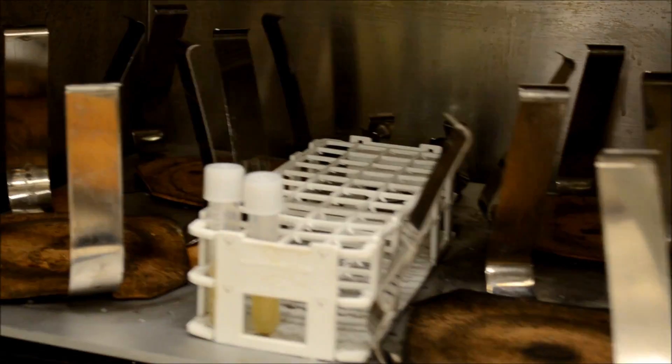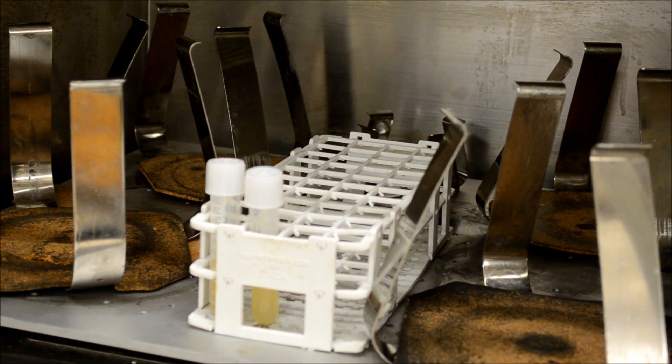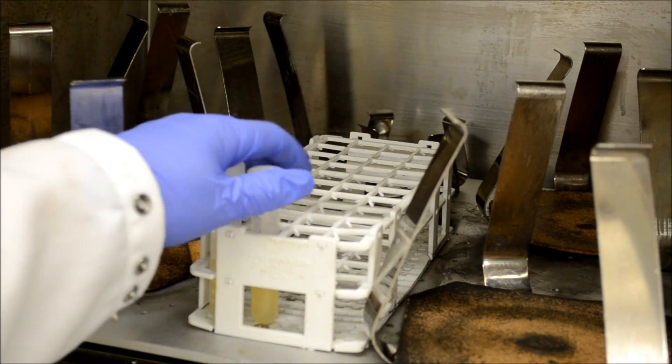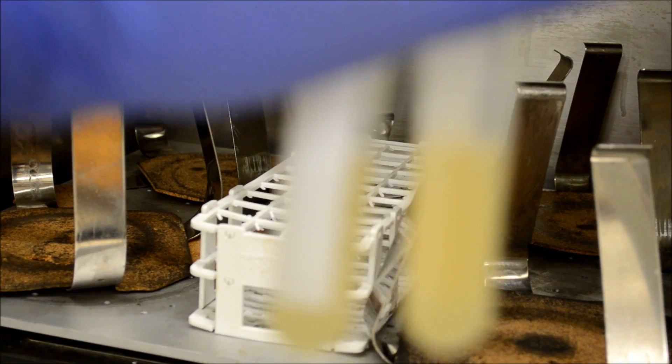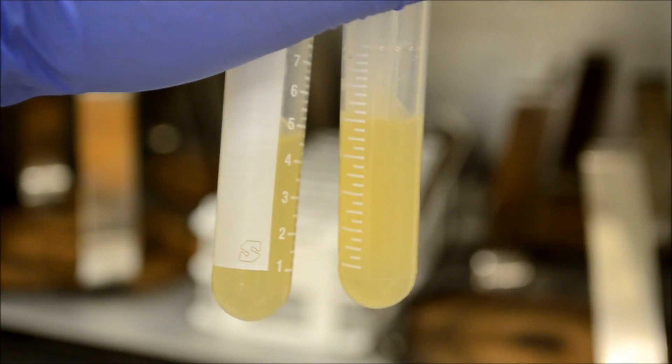First, we will remove the bacterial solution from an overnight growth. You can see here that the two solutions are completely saturated. This means that the bacteria has grown to its limit in these solutions.